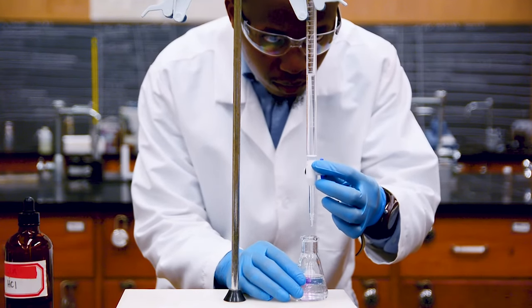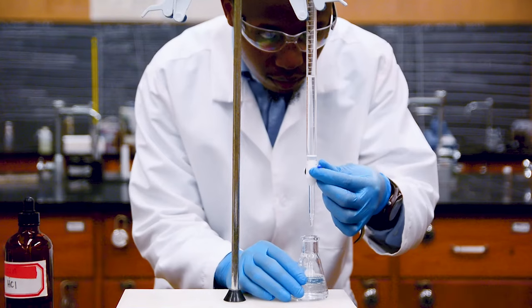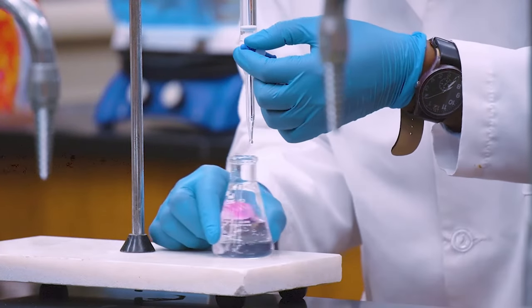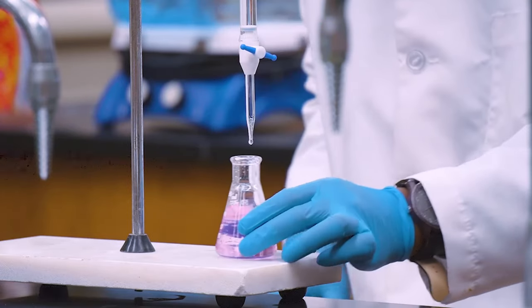We need a color change that remains even after mixing. Keep adding, mixing, and checking. It is important to be careful when we're close, as we don't want to miss the equivalence point by adding too much.